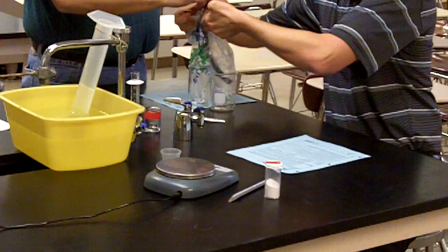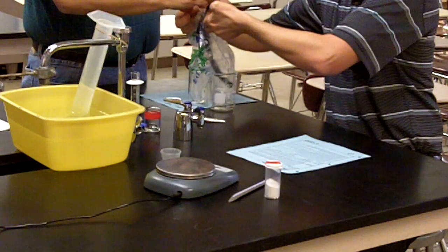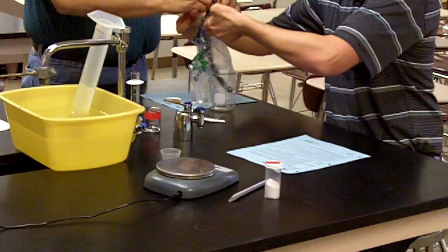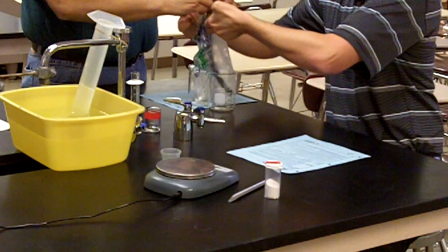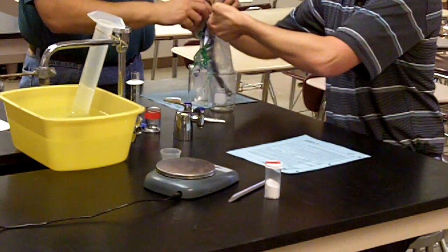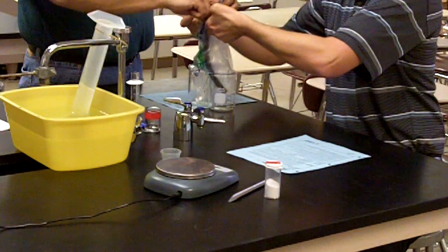Pull it from this end. Let's get it to come down.